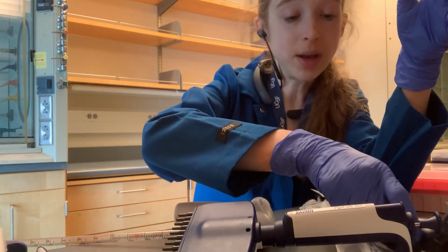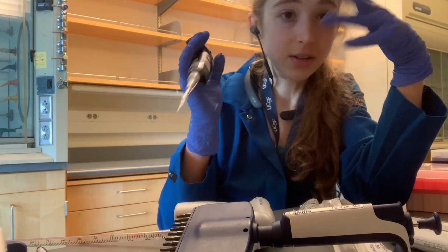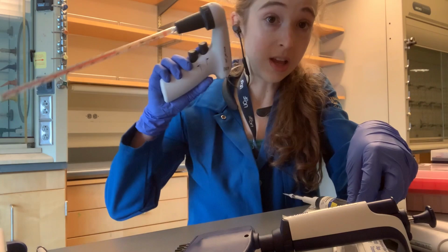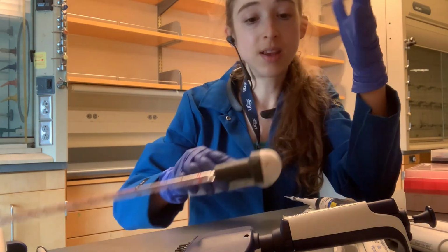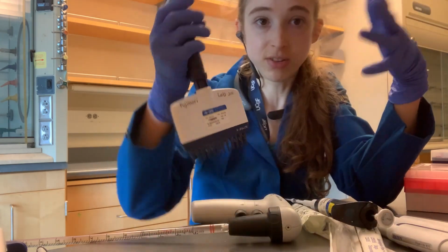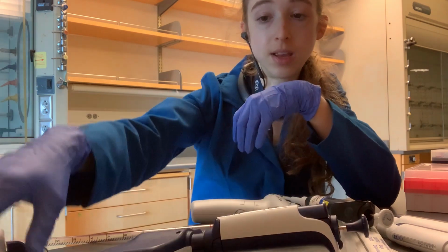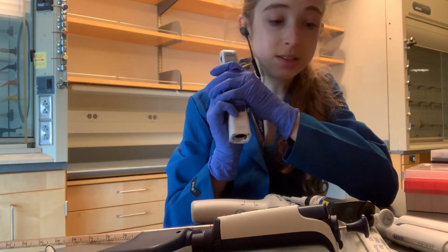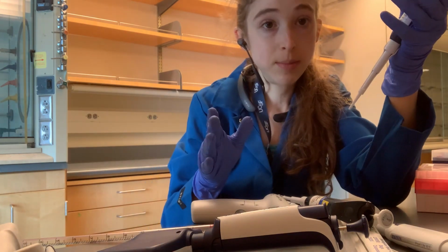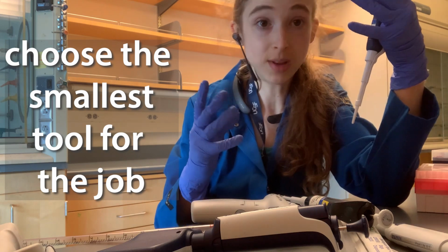So micropipettes are probably the ones that you're going to use the most, depending on your lab, of course. If you're doing a lot of cell culture, you're probably going to be using a lot of the serological pipettes. And if you're doing a lot of high throughput, so lots and lots of samples, screens maybe, you're probably going to be working a lot with the multi-channel. The repeater pipette's really great for making lots of aliquots. With any of these pipettes, you're always going to want to choose the smallest tool that will hold the volume that you want.